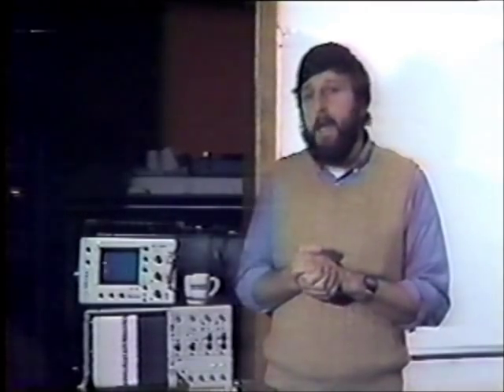Because the channels are such good enzymes, we can actually record their activity in real time for timescales that range from days to about ten microseconds. In this tape, we're going to show you how to make the kinds of recordings required, and a few hints about what counts and what doesn't count.